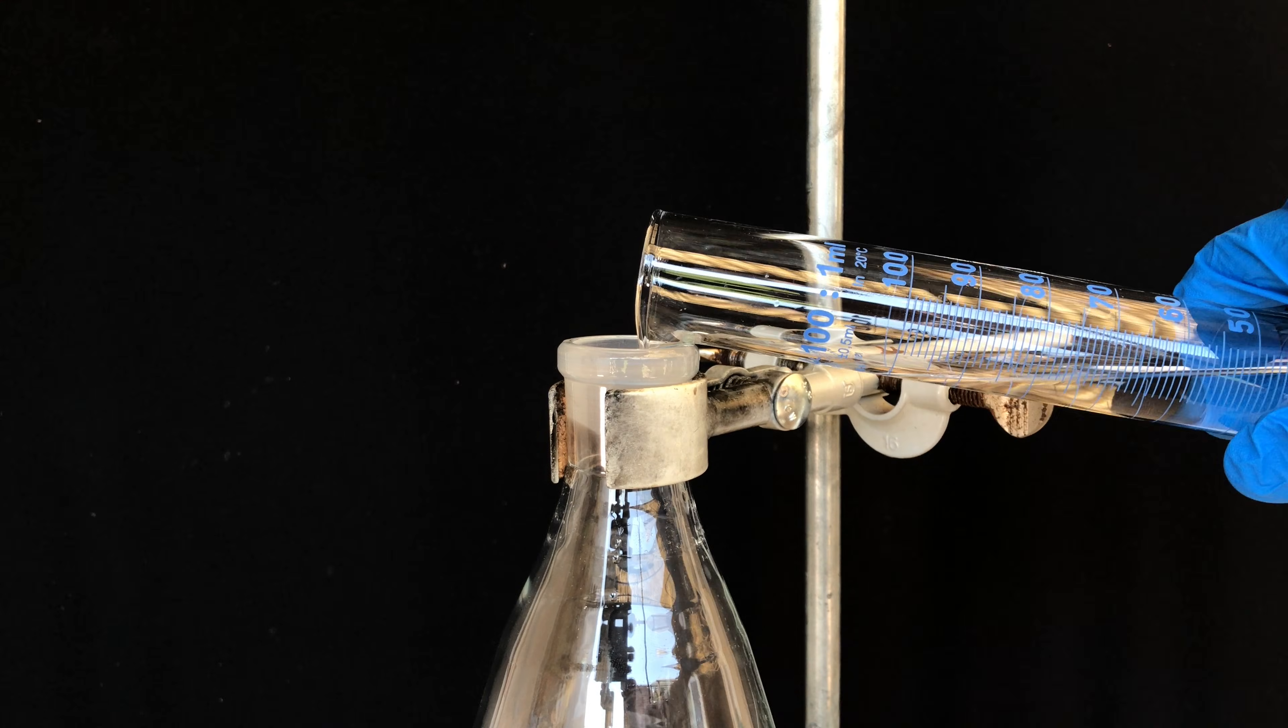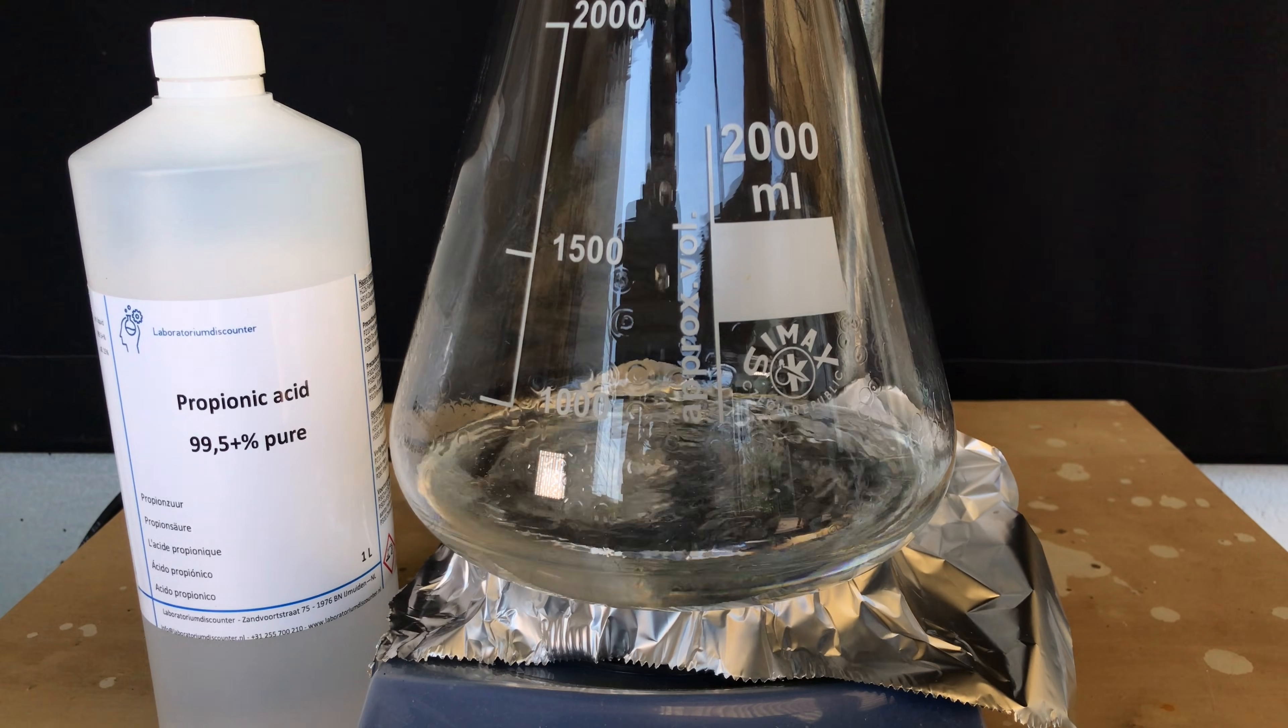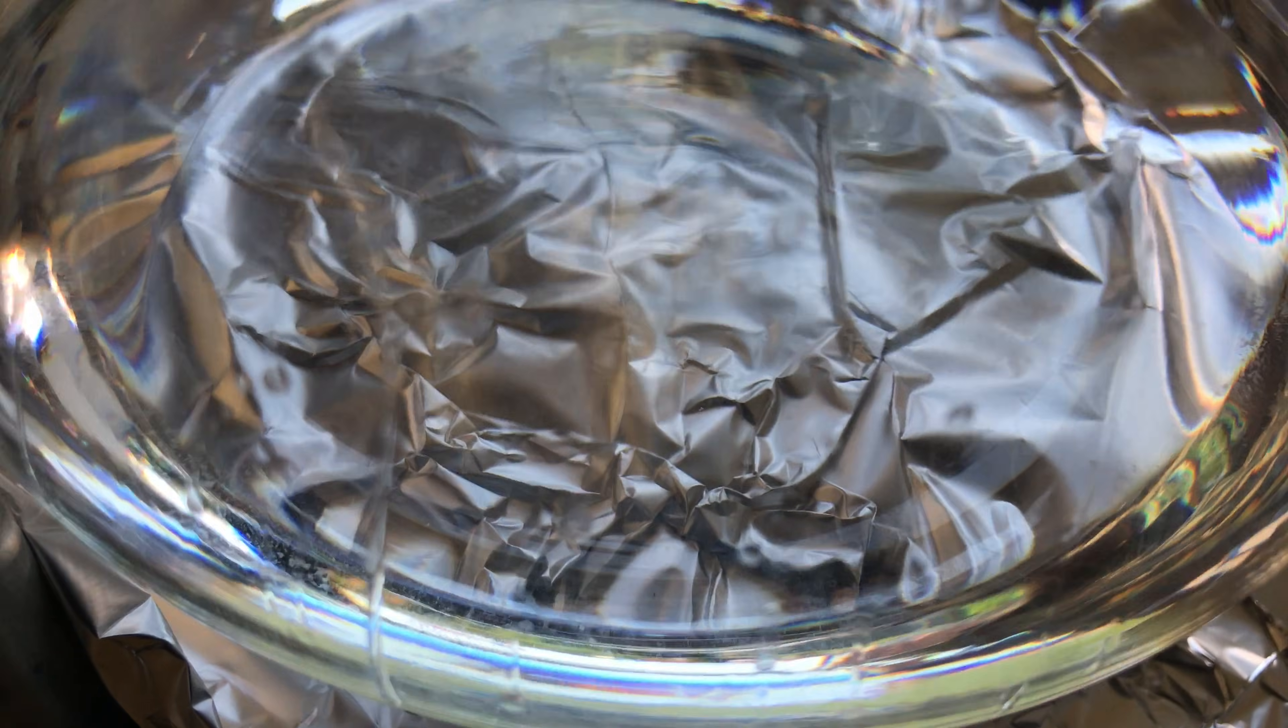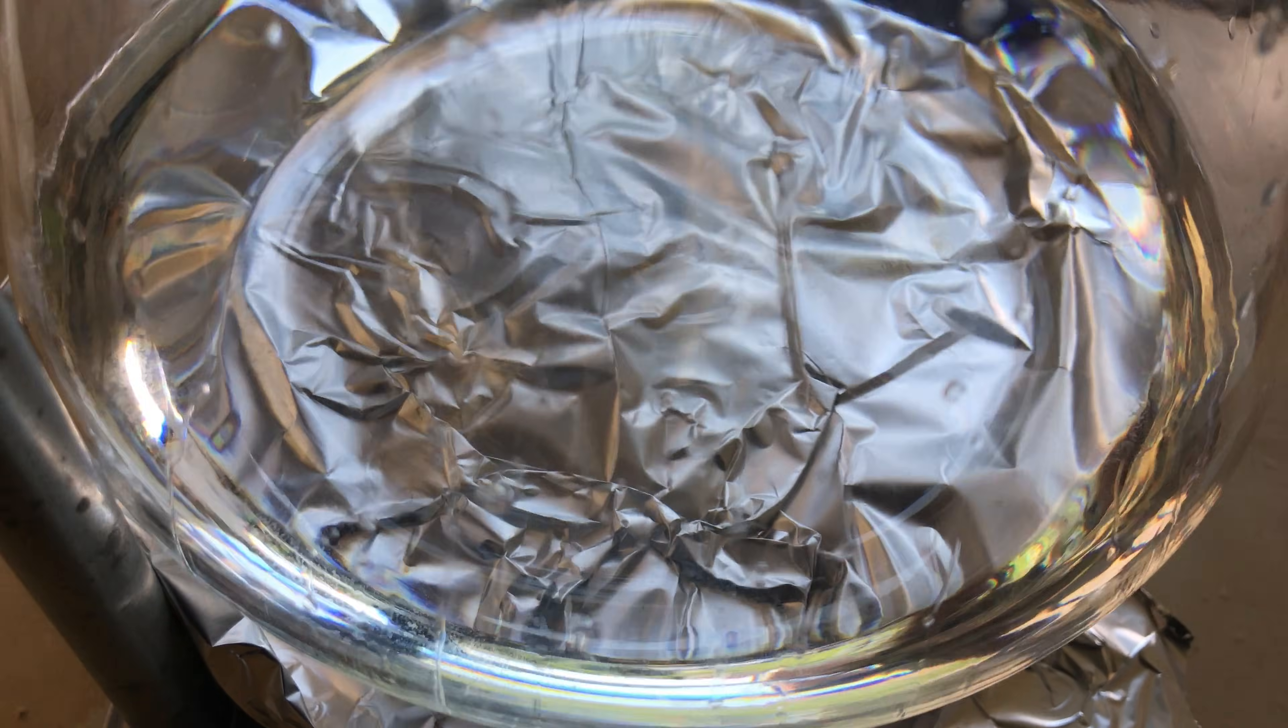This method is suited for propionyl chloride and acetyl chloride. I don't know about butyryl chloride and anything above that, but for propionyl chloride it works decently well.